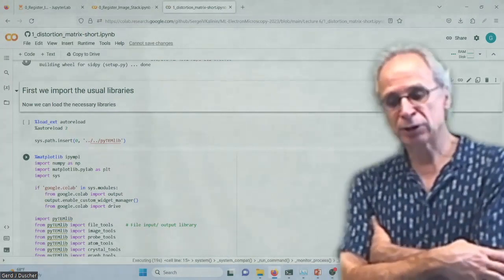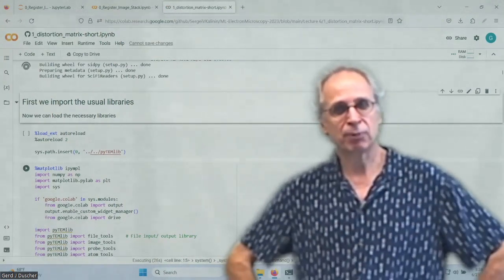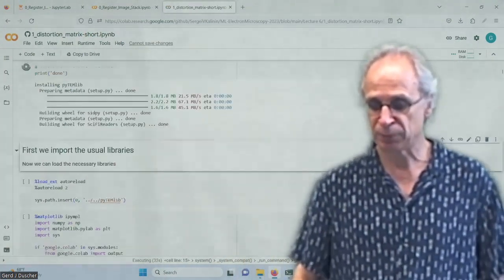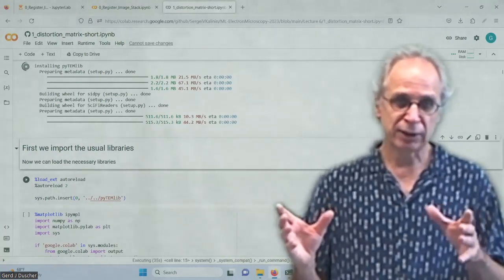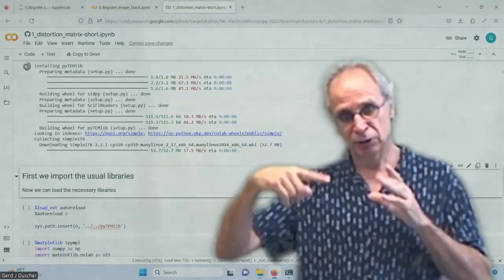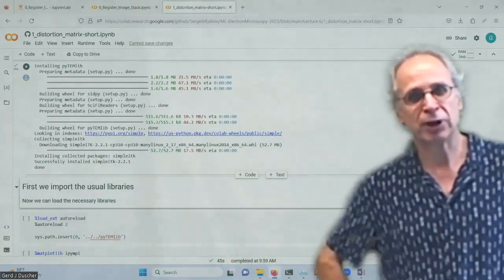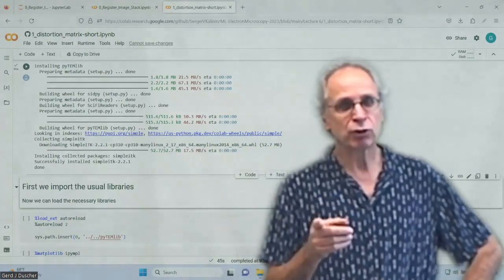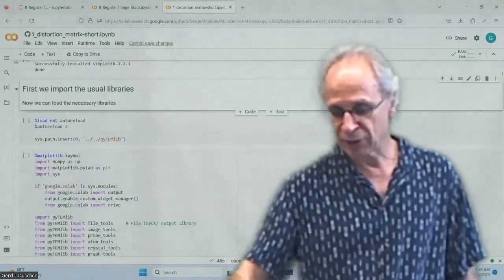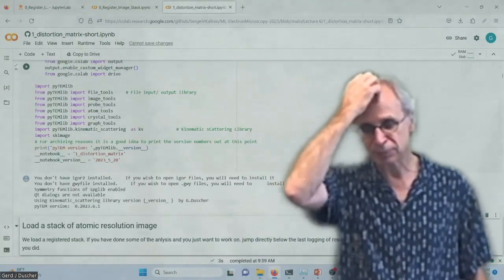And we have one other notebook still where we are doing the graph theory, and that's where you can see where the strain and so on are determined of an image. So because we have strontium titanate, I just said, oh, okay, this is also strontium one that makes it the unit cell. In the titanium oxygens, I determine how far away it is from the center. You have to sort them first, right? And that's what we are going to use graph theory for. So we have that imported. This one we don't need. It's left over from my computer.